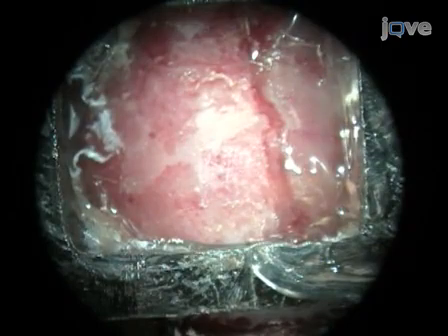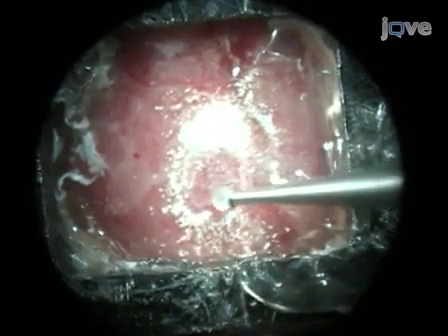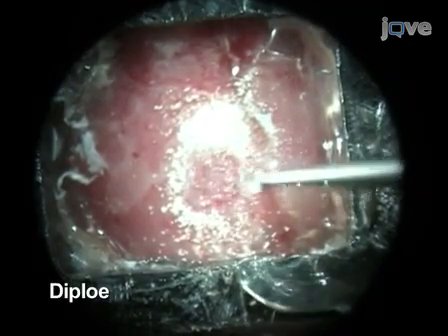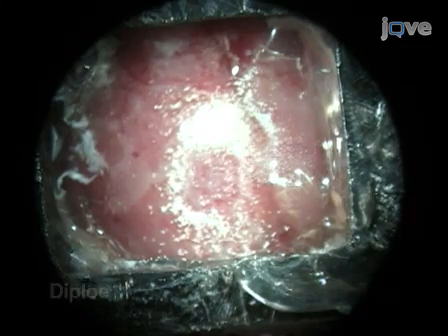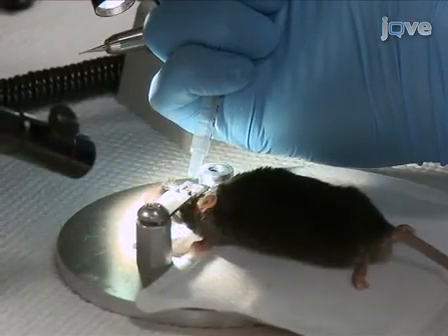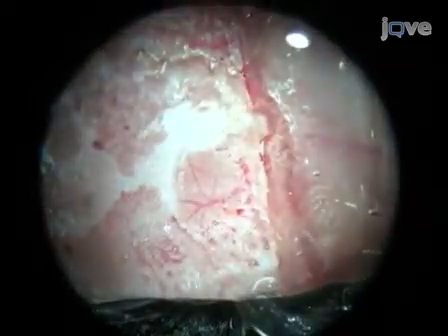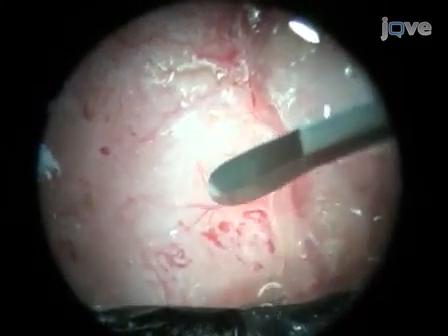As the drilling progresses, notice the transition to the moister spongy bone layer called the diploe. Once this layer is reached, exercise extra caution with the drill. Occasionally check the thinness of the skull by placing saline over the thinned area and viewing under the dissecting scope. Saline will further enable heat dissipation. As the skull is thinned, smaller vasculature becomes visible.